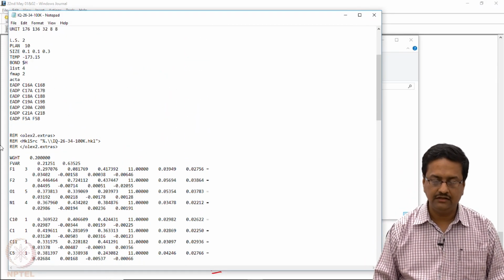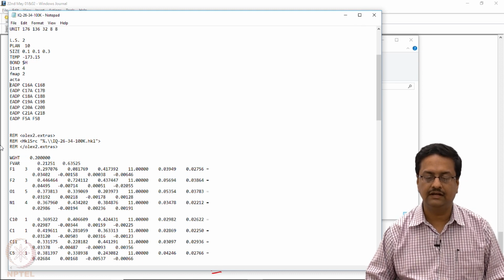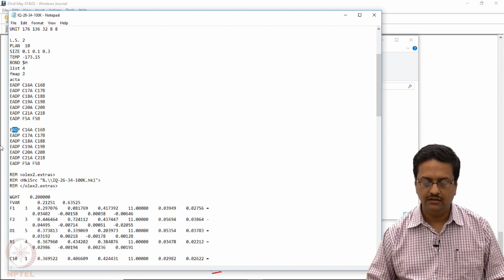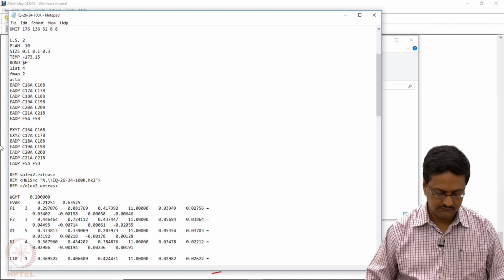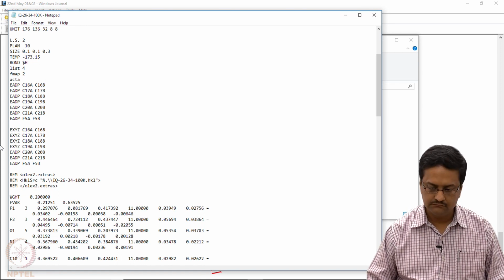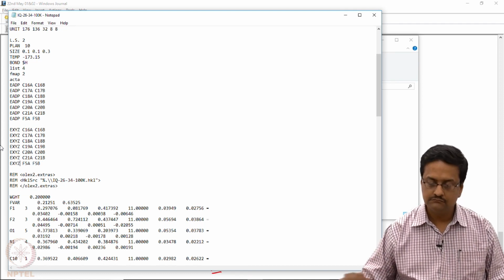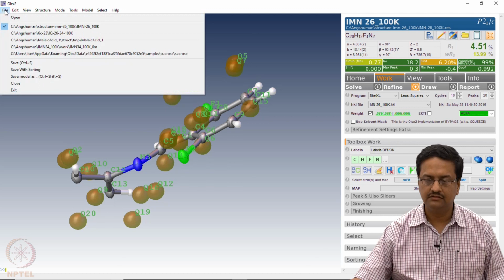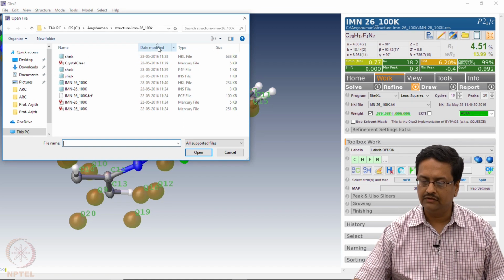and simultaneously we should write the corresponding EXYZ for all of these set of atoms, group of atoms. So copy and paste it here and change the ADP to XYZ. And save this RES file. And now we go back to our structure solution and select the RES file that we have just now modified.